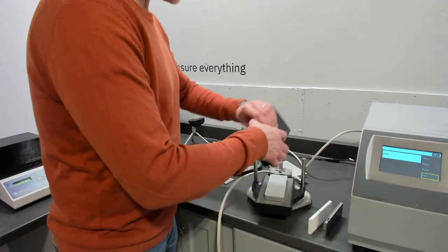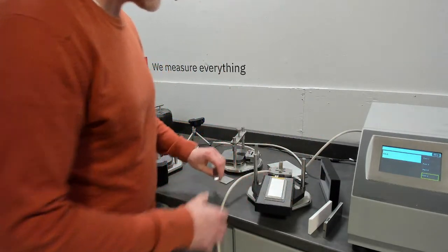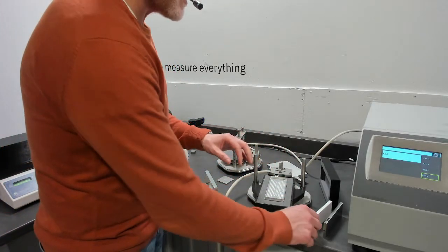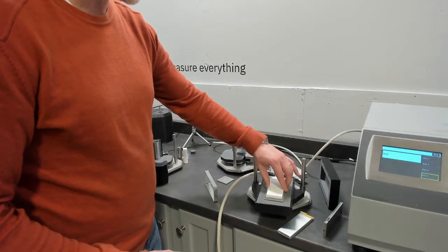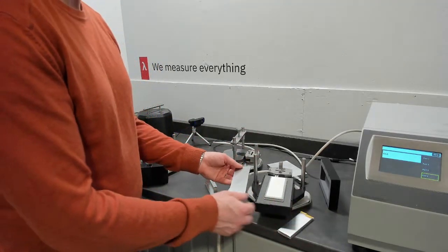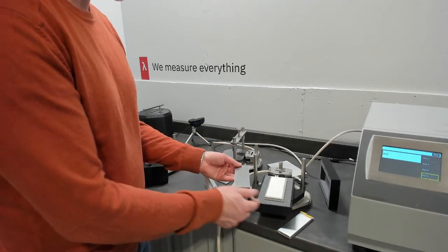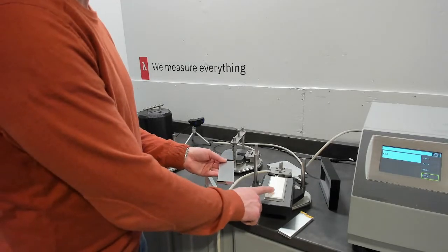So with every specific heat measurement, we also offer references. In this case, we have a Macor reference. This can be used to verify operation of your sensor if there's any doubt. And we have 304 of the same dimension. What's nice about having two very different conductivities is when you're measuring anisotropy, this is around 13 or 14 watts per meter Kelvin, this is around 1.5.